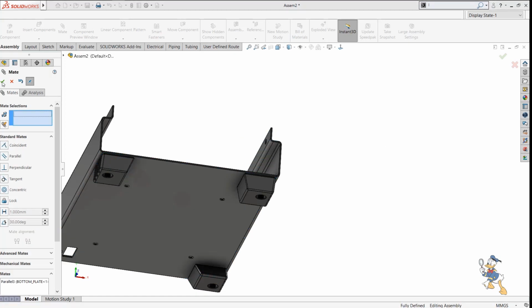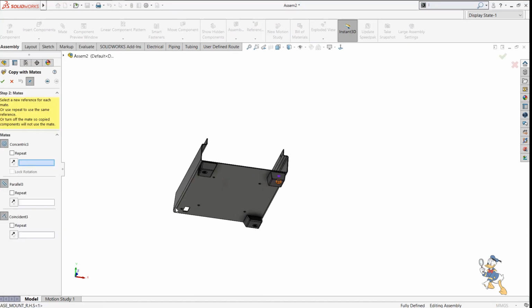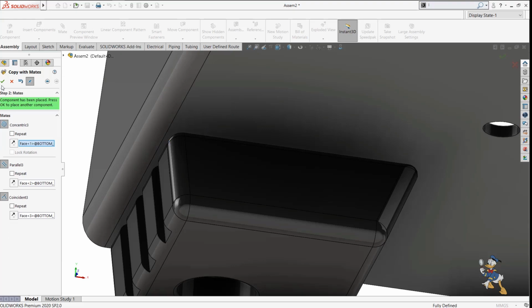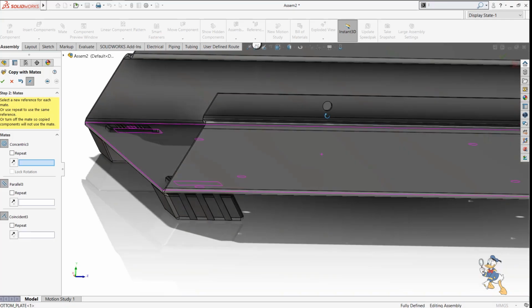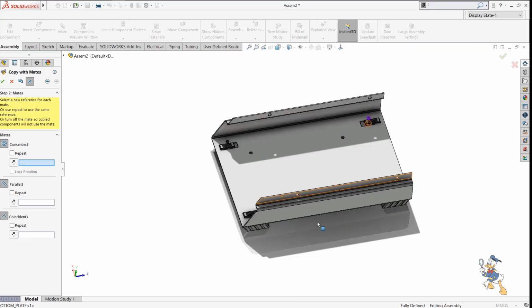So yeah, this is available for us. I can check it out. I can copy with mates on this feature as well. So I just need to provide some neat features which we have provided for that, and we will generate this kind of assembly. So we have started the assembly by making the components and providing the value to this.